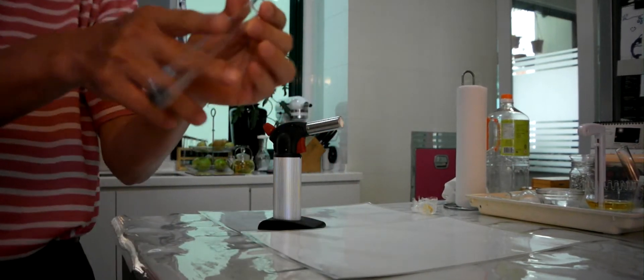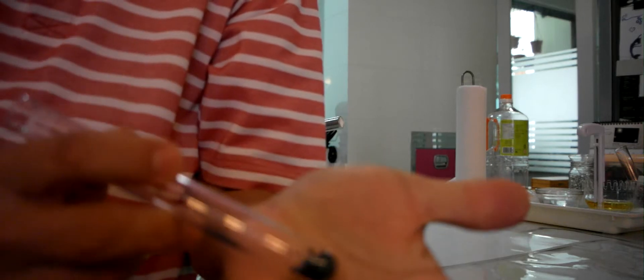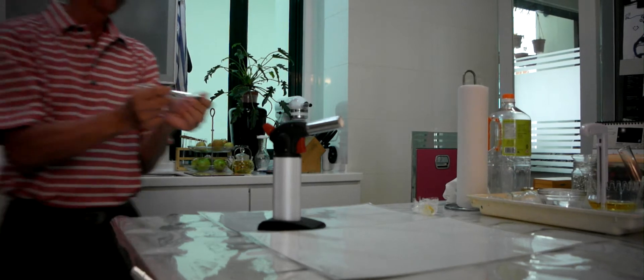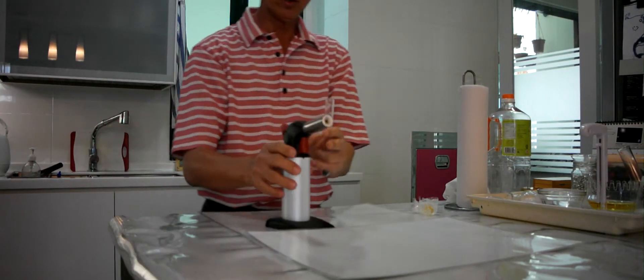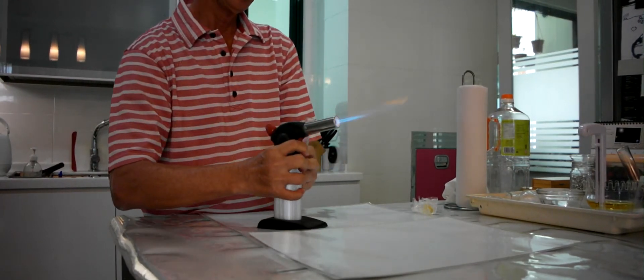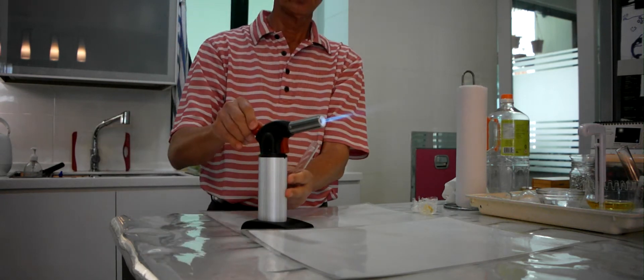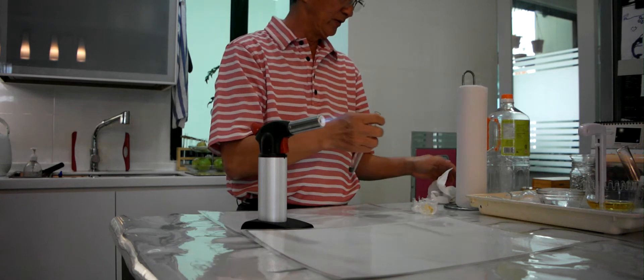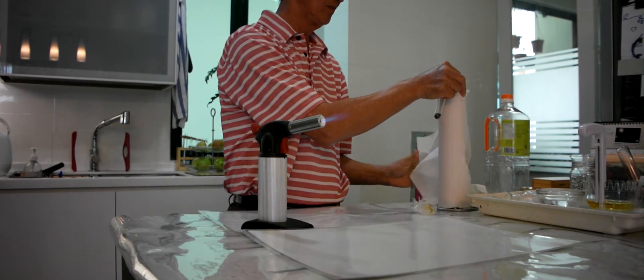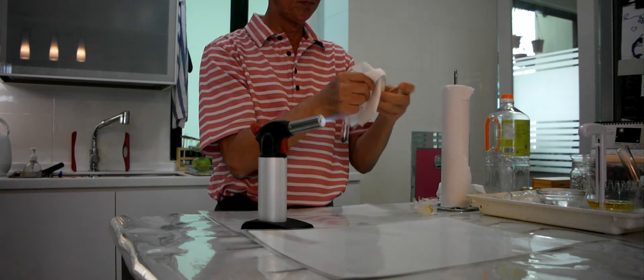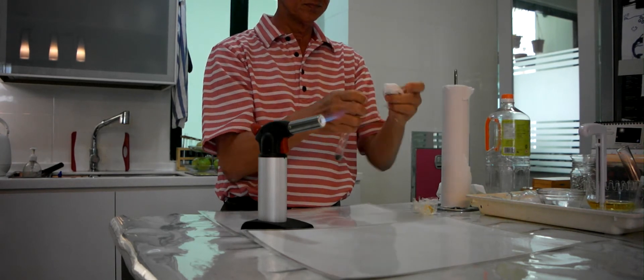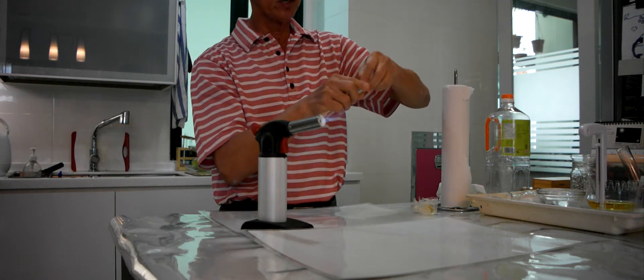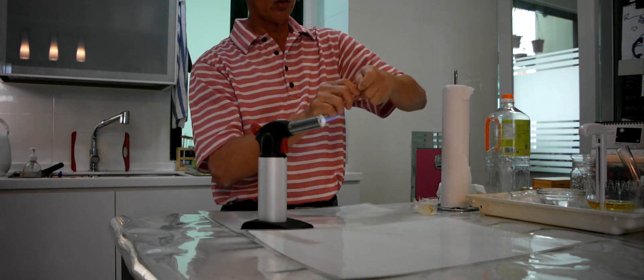So these are the iodine. Now we are going to heat it with a low flame. And we are going to put some stopper, some paper stopper at the top. Because we are going to pour the liquid iodine out.